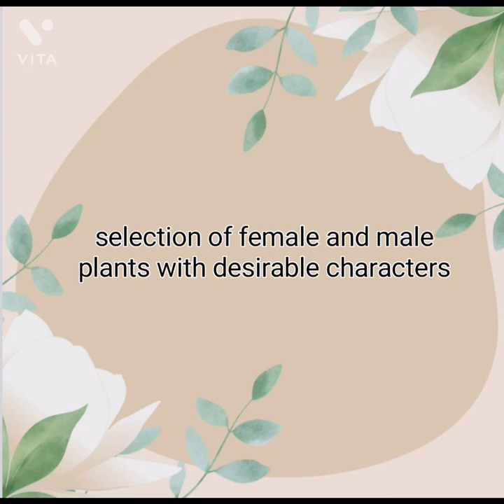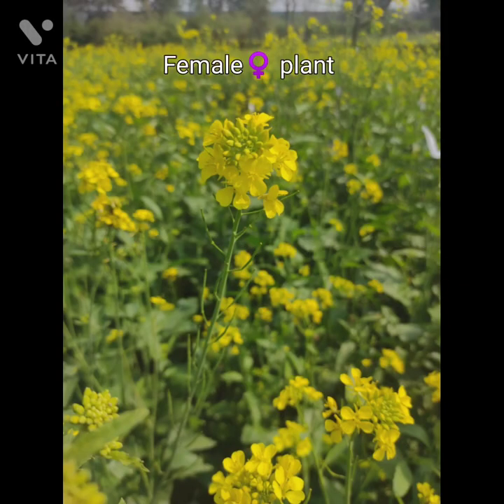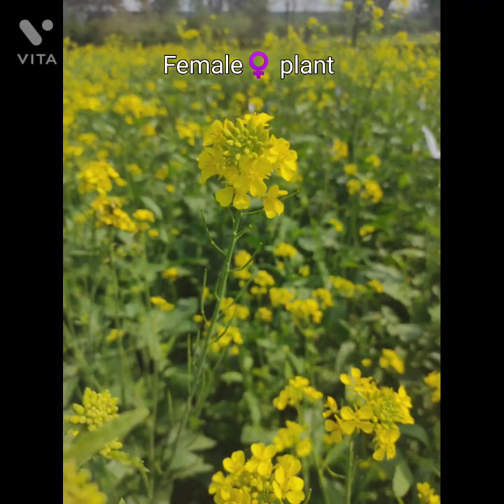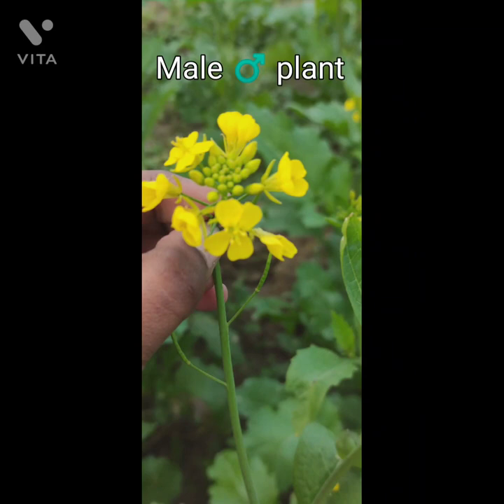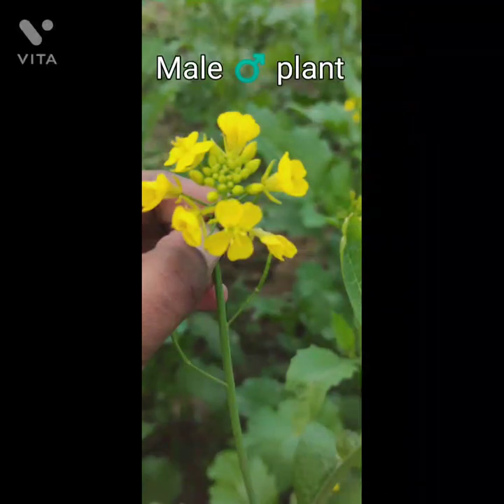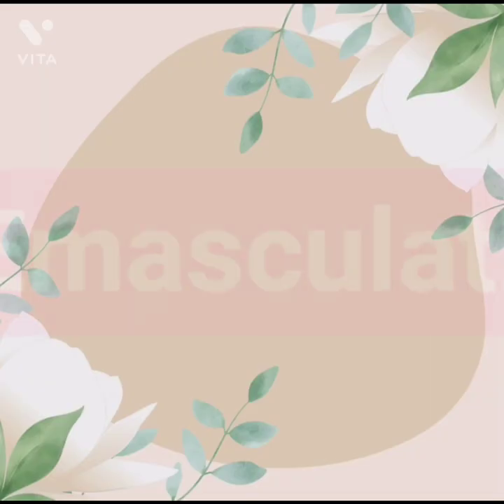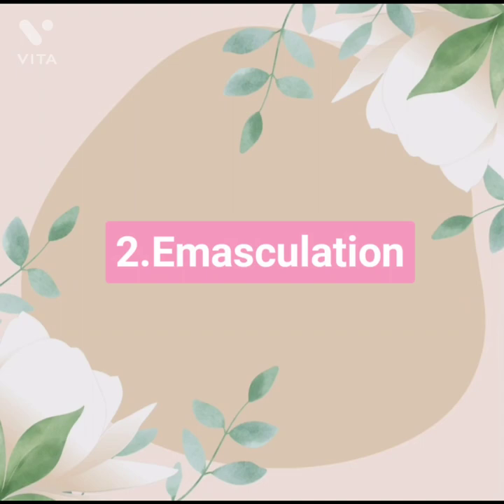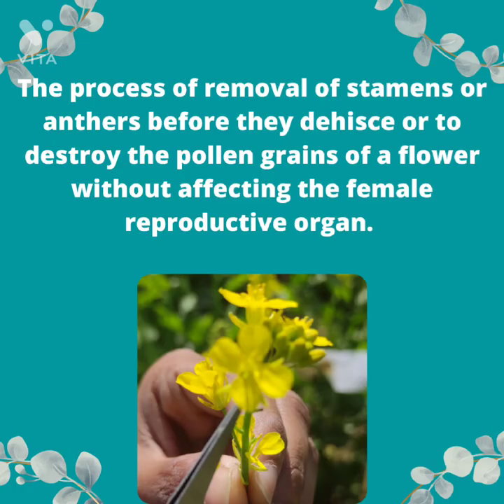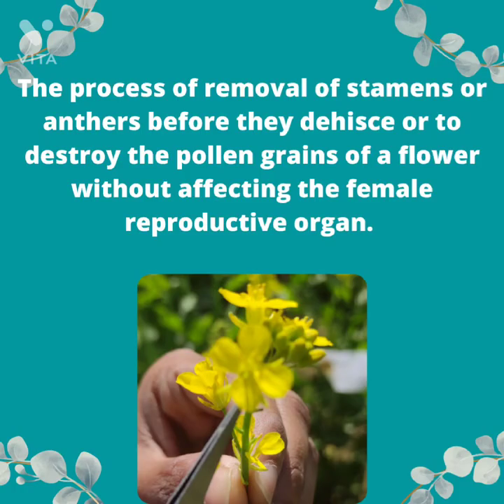This is a female plant and this is a male plant. This selection depends upon our objective of hybridization. The next step is emasculation. The definition of emasculation: it is the process of removal of stamens or anthers before dehiscence, to destroy the pollen grains of a flower without affecting the female reproductive organ.